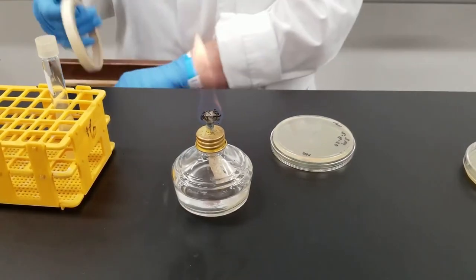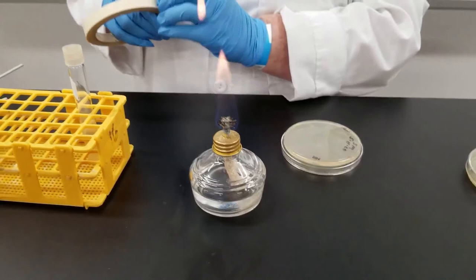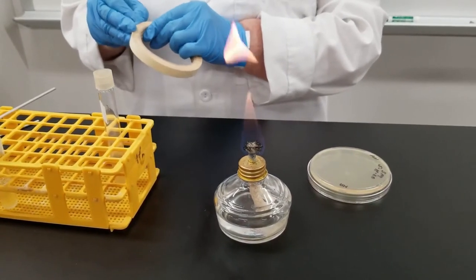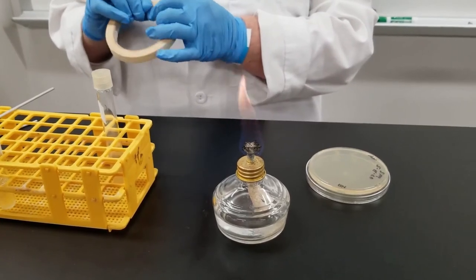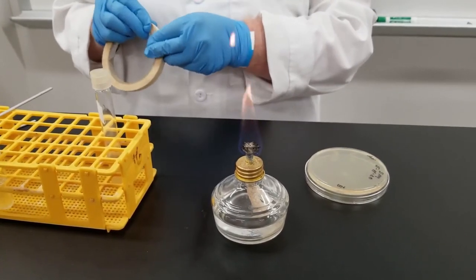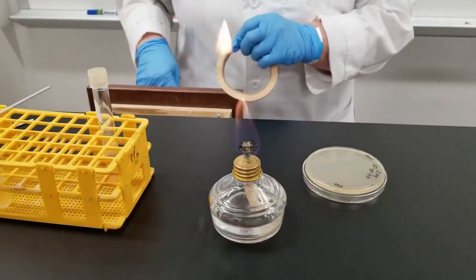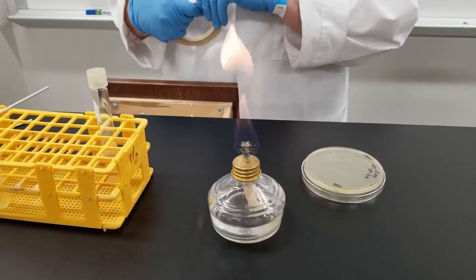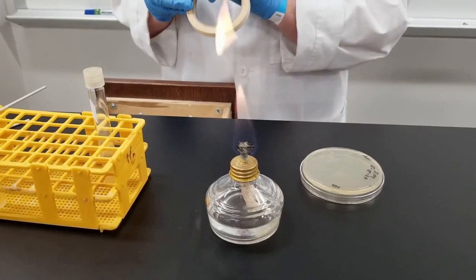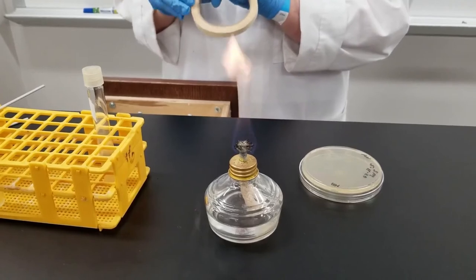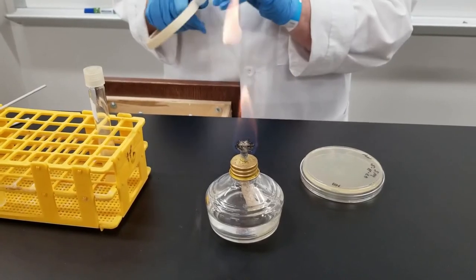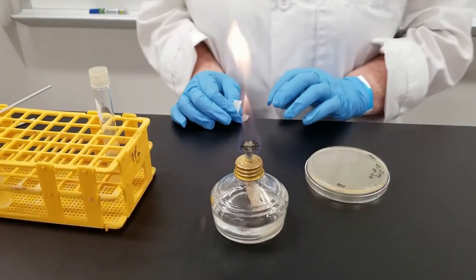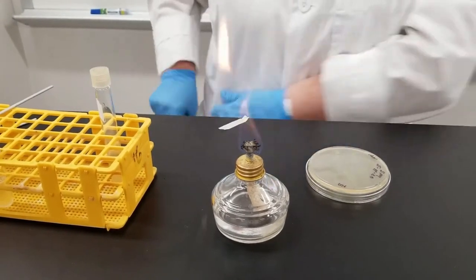Just about anything will grow on that. Sometimes you may want to label things with a piece of tape. Whichever you choose to do, it does not matter. Just as long as you do label everything. These will be incubated at room temperature. Sometimes you'll incubate at 37 degrees. Sometimes at room temperature. It just depends on what you are doing. And for this particular exercise, I do want to go at room temperature.